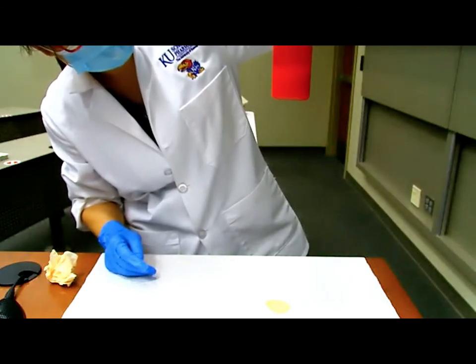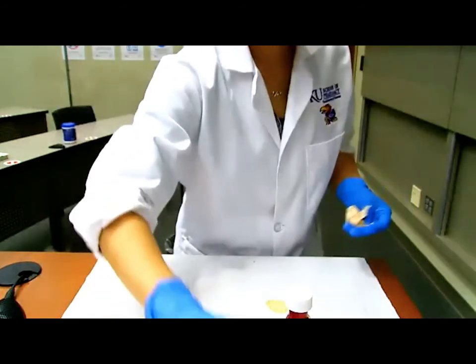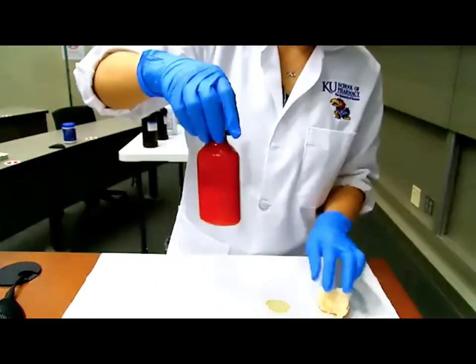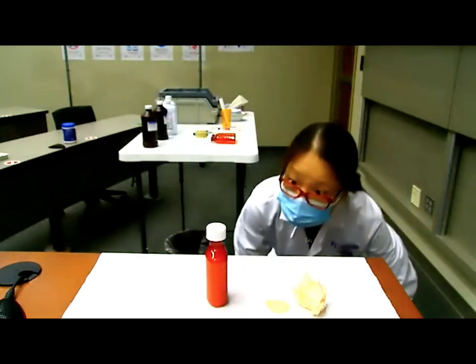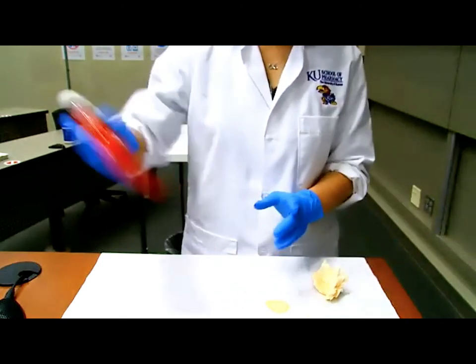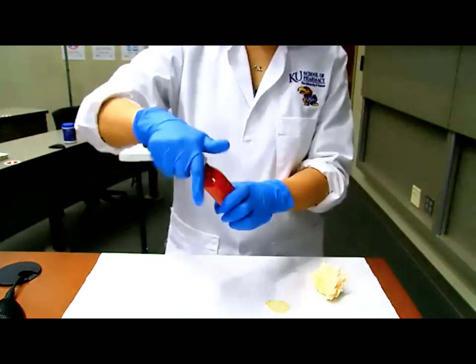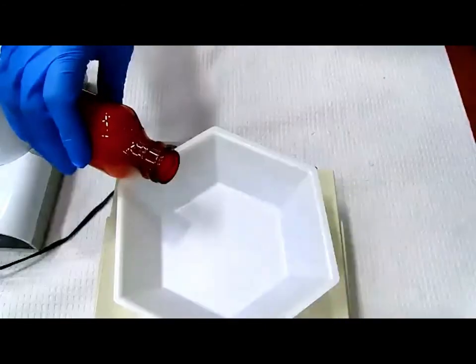It's uniform now. So let's finish up at the QA, Dr. Wood. Tell us exactly, carefully look on there, and let's leave it on here so they'll be able to see it. What is the QA volume, what is the final volume on there? The final volume is 60 mils. So 60 mils under your QA final volume, and now she'll pour some out into the weigh boat, and we will describe the final product. Let's take a look.